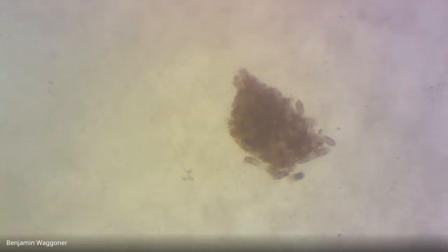Okay, I think that's the same bunch as where we were. And okay, there's another air bubble right there. You're focused on the film of water, not on your own cover slip or anything like that. I think that's just dirt on top of the cover slip. You are going to want to keep these as clean as you can.